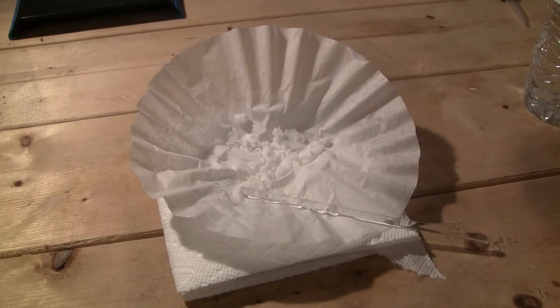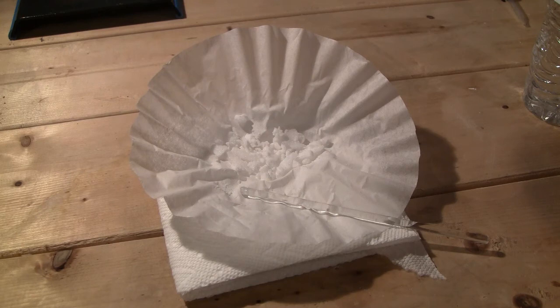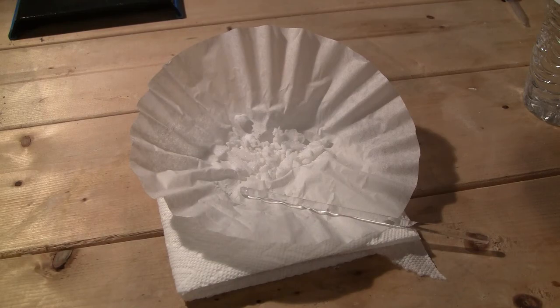The final yield is about 5.876 grams of boric acid, which correlates to percent yield of 58.6%. This yield isn't great, but the spills and slight solubility of boric acid in cold water could explain the poor yield.